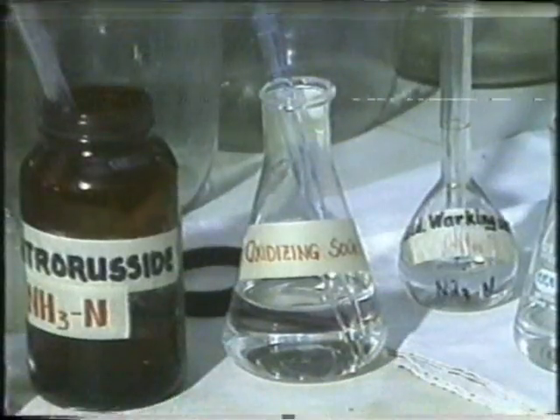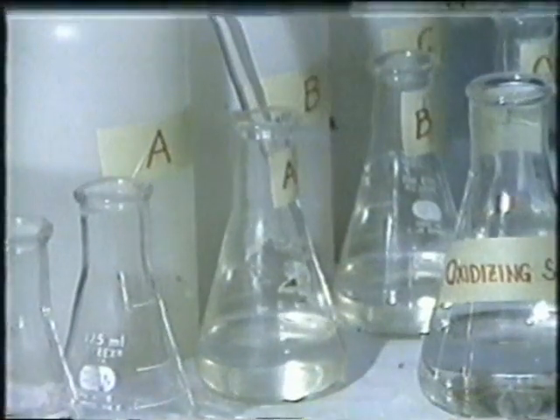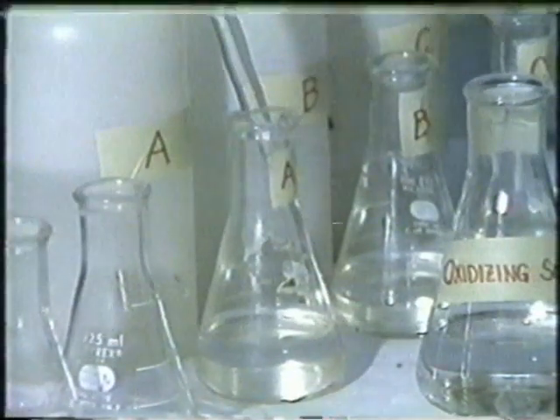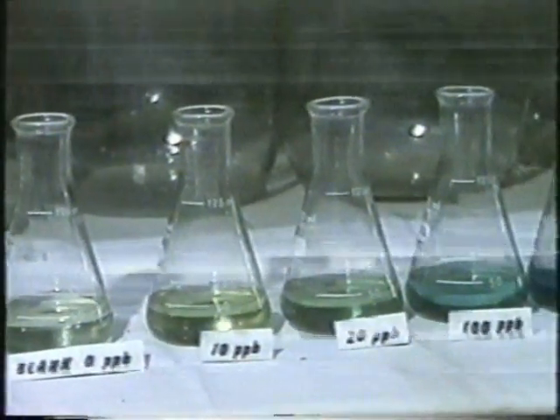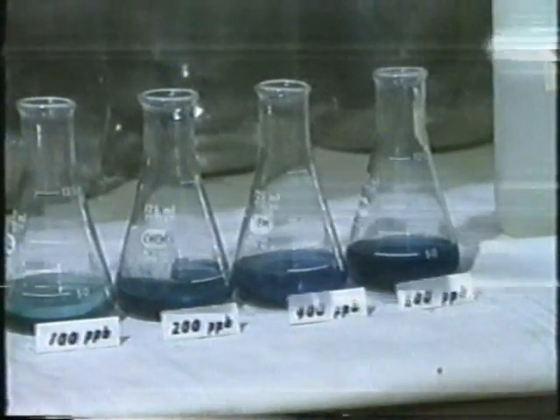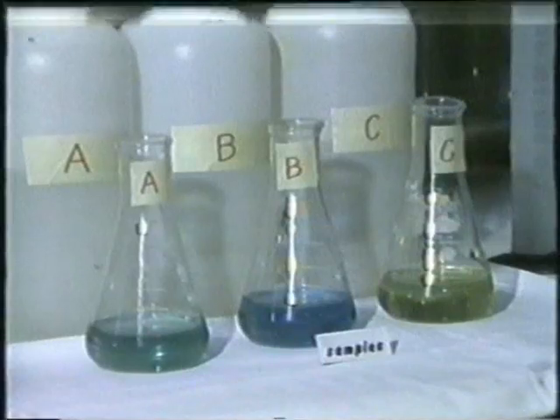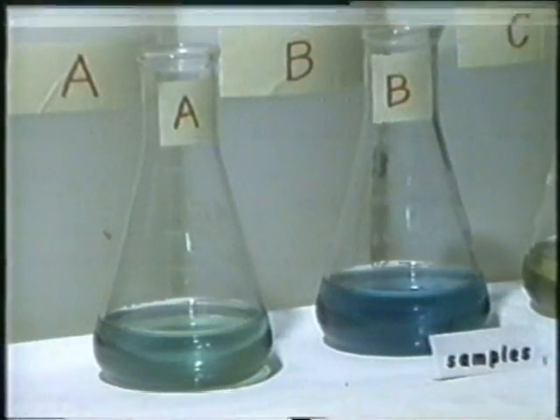Lastly, 5 milliliters of oxidizing solution is pipeted into each and allowed to stand for about 1 hour. After 1 hour, the standard dilutions with increasing known amounts of ammonia nitrogen show increasingly intense blue coloration. The water sample shows varying intensities of blue coloration according to the amounts of ammonia they contain.